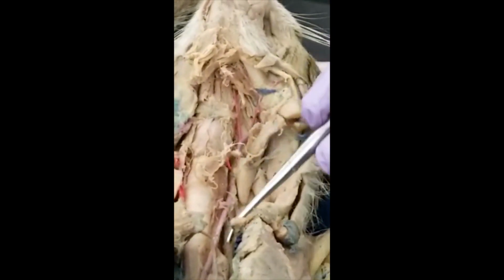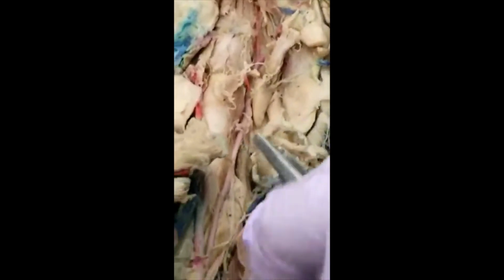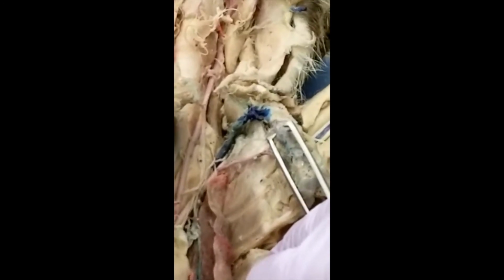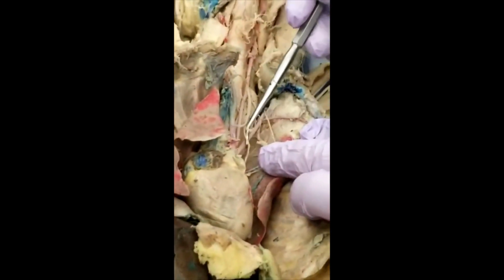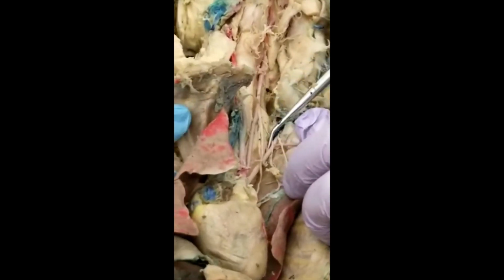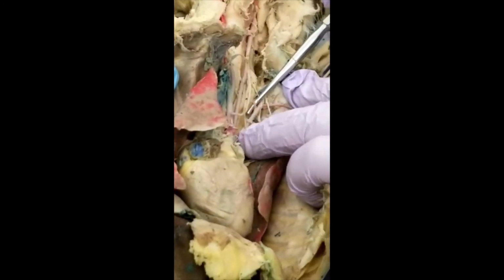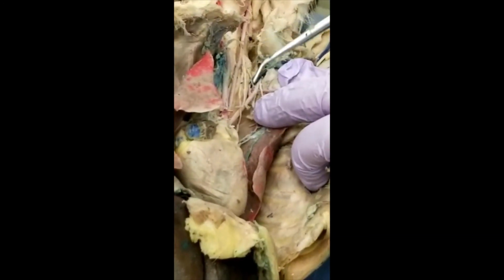So that's you going all the way through this left common carotid. And the next one we go through is the left subclavian. Can you push this down? This piece. Okay, thank you. So this is the left subclavian. You can see this one is the internal mammary. And on this side, you see the early one that comes out. That's the vertebral. You see the vertebral.